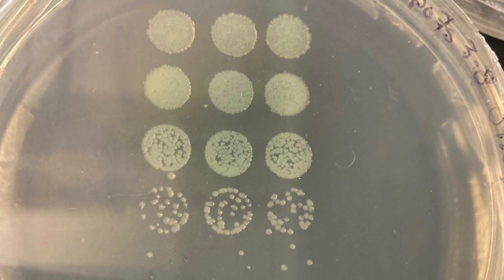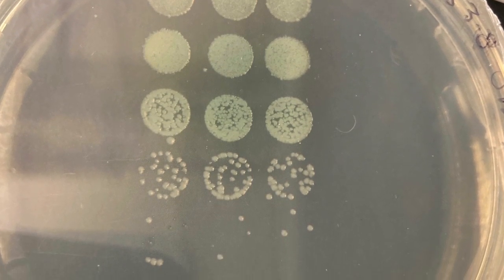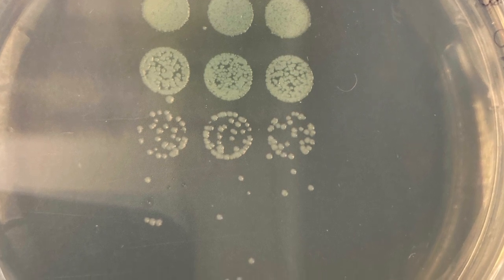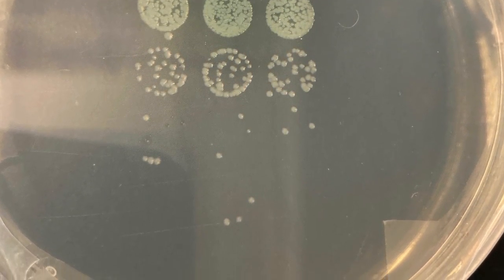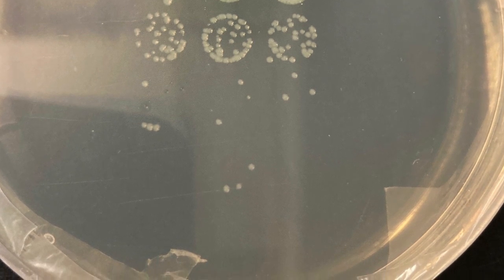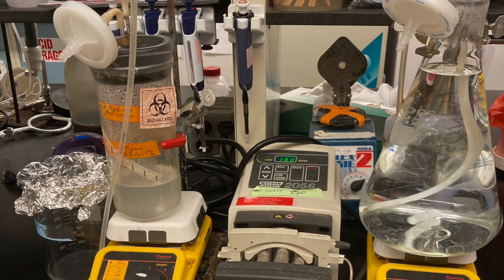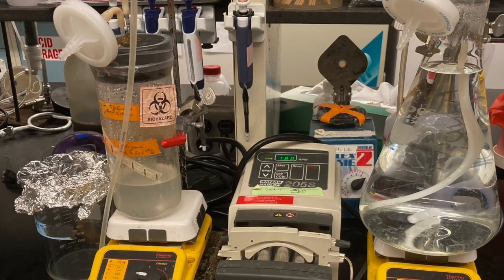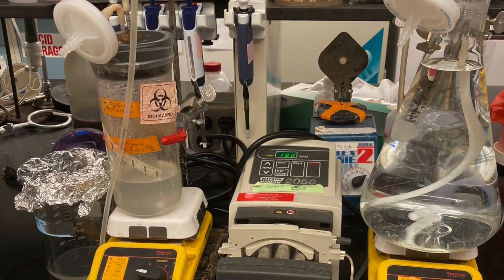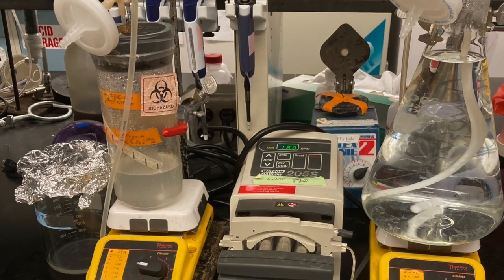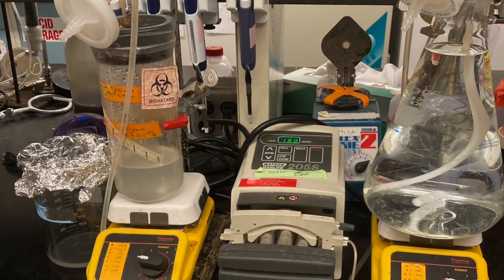After the chemostat setup is complete and run for 24 hours about 1 residence time, an OD concentration curve can be identified by taking a spot plate of the chemostat sample. The chemostat will now supply a continuous sample of your target organism. The target organism for this chemostat is Pseudomonas aeruginosa.